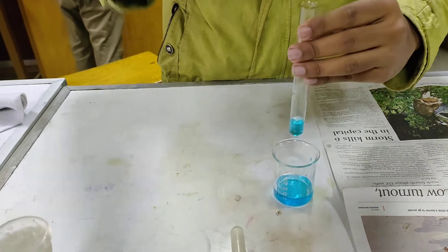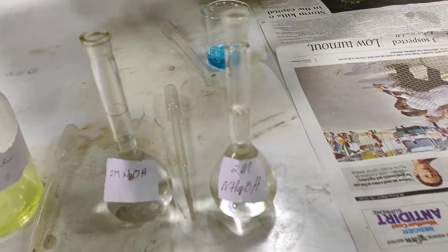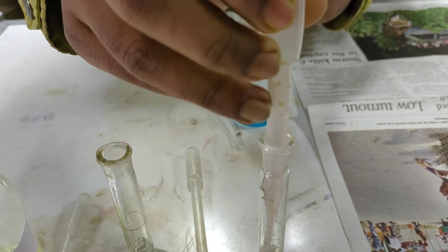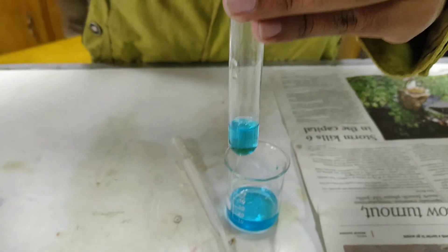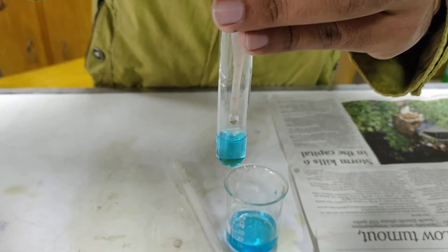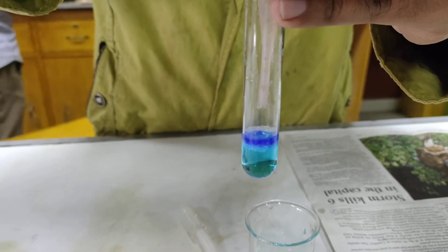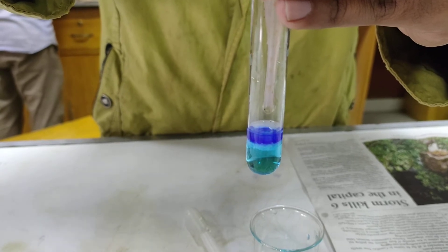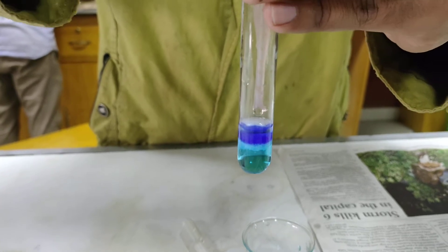In another test tube, we are taking another 2 ml sample solution. Now we are going to add dilute, that means 2 M ammonium hydroxide solution. Like the previous test, this will also produce a blue precipitate — and the precipitate is blue. Adding excess amount of ammonium hydroxide produces a deep blue color.